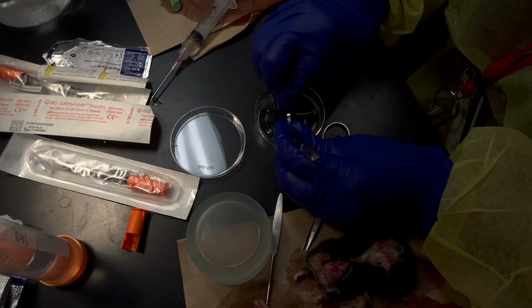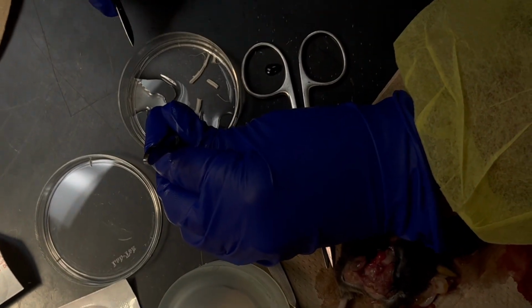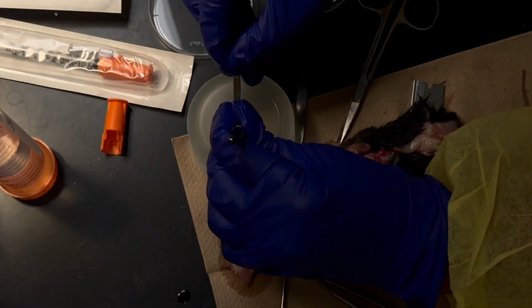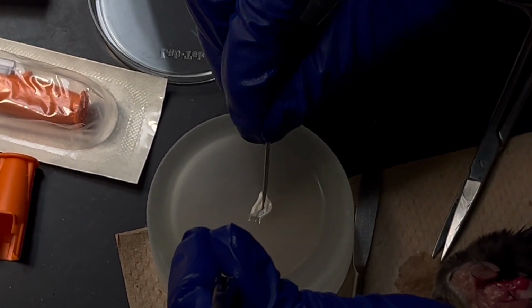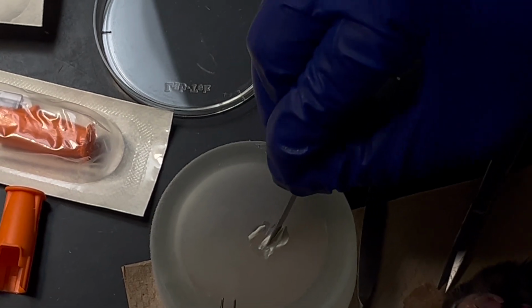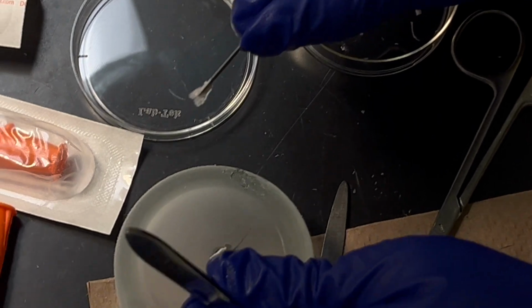Okay, so let's say this is what I think the lumbar part is, right? So we keep it like this, and I know this is dorsal because you can see that white line, right? I'll transfer this whole thing here, and the moment I transfer, I cut them and then flip them. I remember it's the four, and then I know this part, this, and this. That's four things. So this two that I got is actually the ventral, right? Yeah. So ventral ipsi, ventral contra, whereas this was dorsal ipsi and this was dorsal contra.